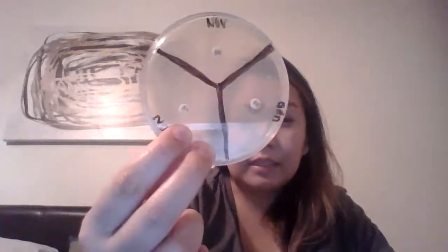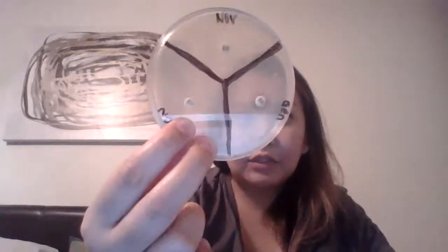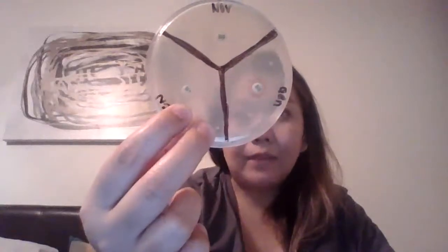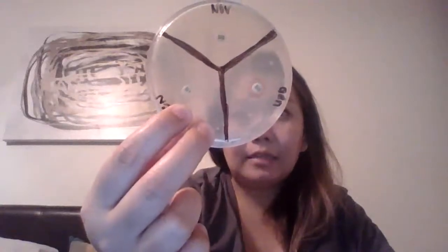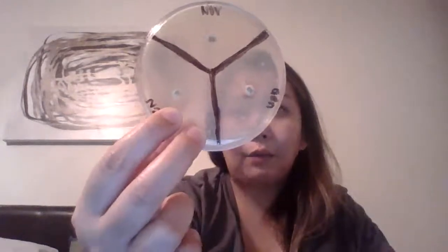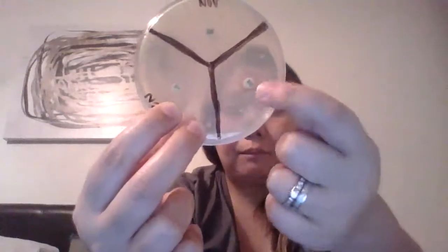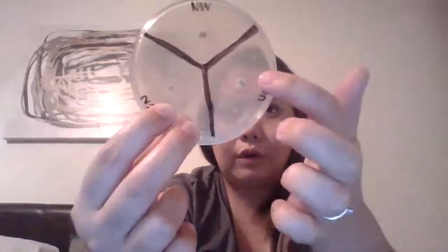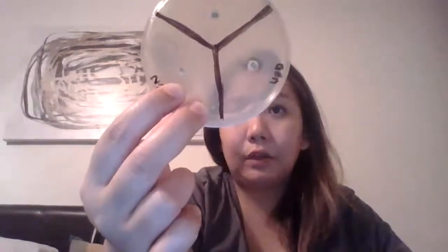As you can see, gentamicin is actually sensitive to S. epidermidis. I know this because it inhibits growth around — they call it a zone — around the actual disc. You can see the clear patch where there was no bacterial growth at all.